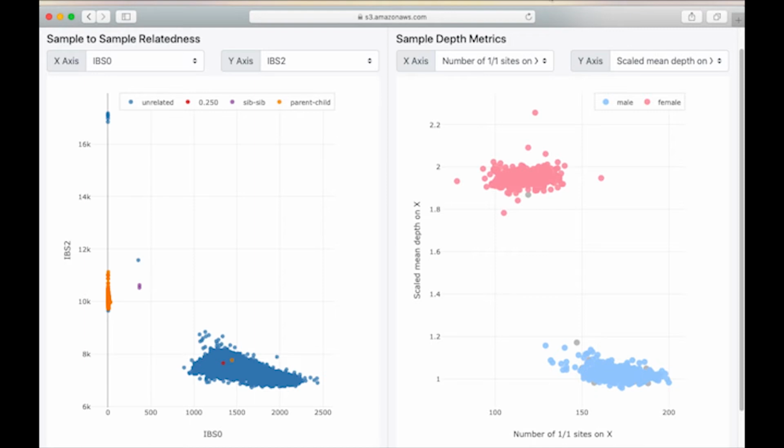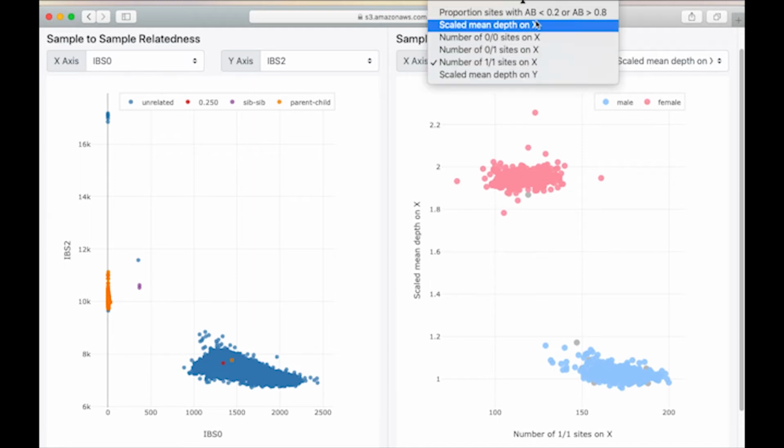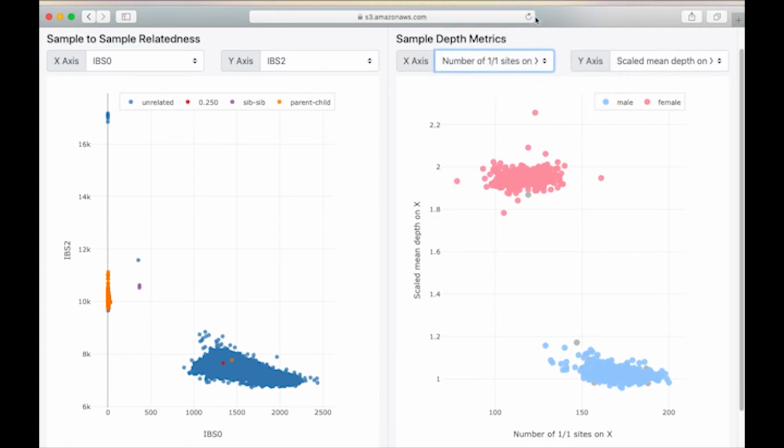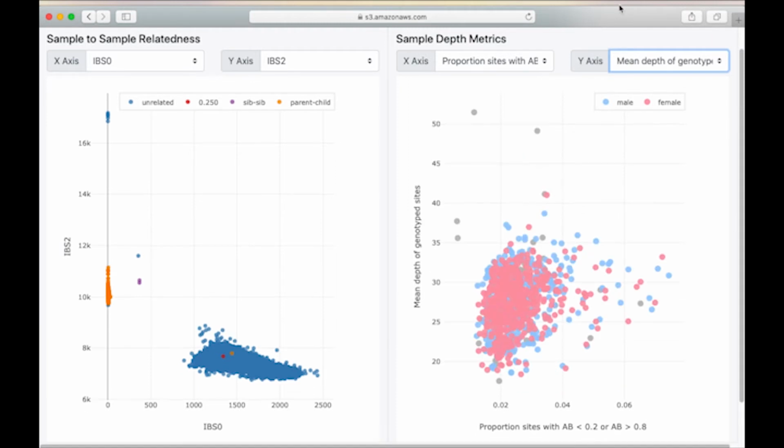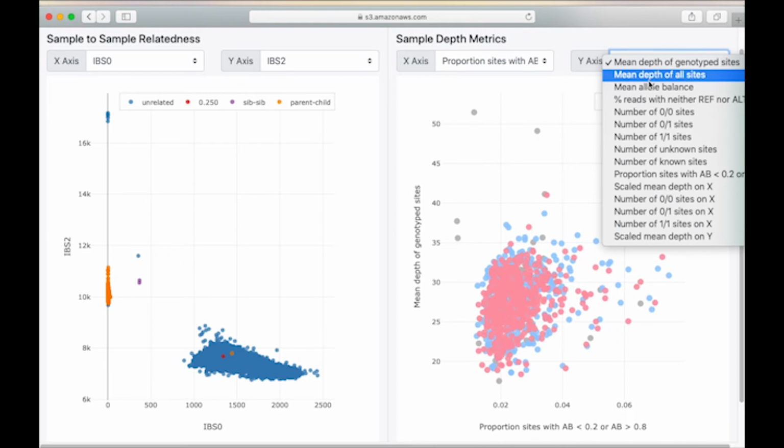New plots can be dynamically generated by changing the axis values from the drop-down boxes. For example, another good general quality control check is to compare the proportion of sites with an allele balance outside of 0.2 to 0.8 to the mean depth of genotyped sites. Samples with a high value on the X are generally of lower quality, though there are no extreme outliers in this cohort. Also, we can see that most of these samples were sequenced to around 25 to 30X. There are many other options to choose from. The number of known sites can also be informative.